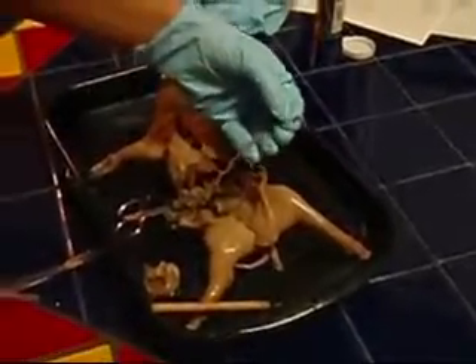We're only going to do a little bit here, but you need to pull apart all the mesentery tissue and arteries and measure the small intestine using your ruler, measuring in centimeters.